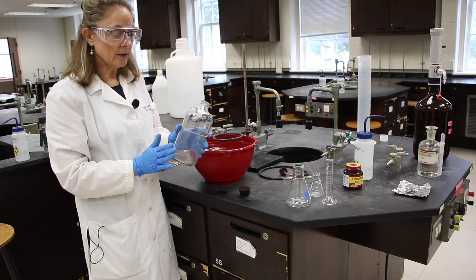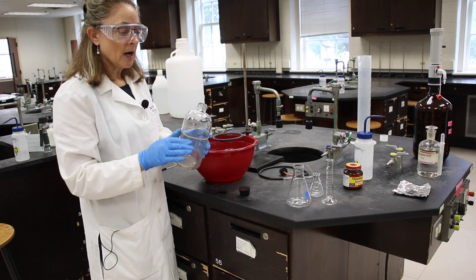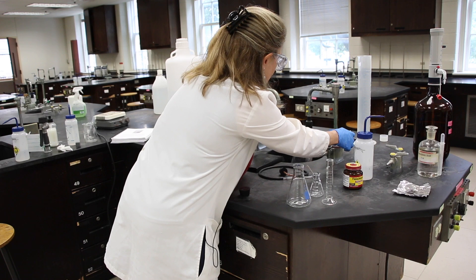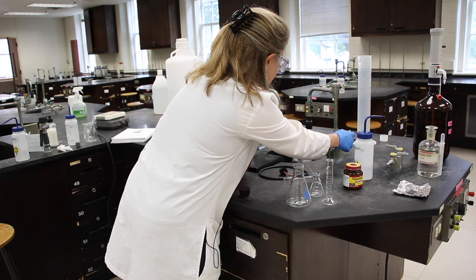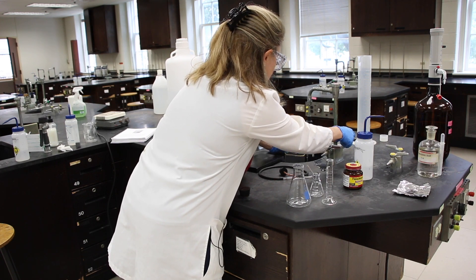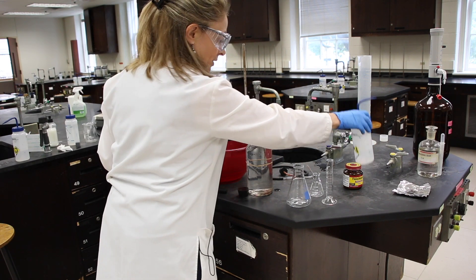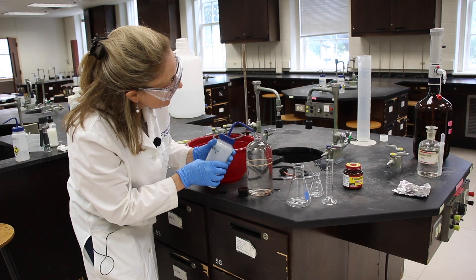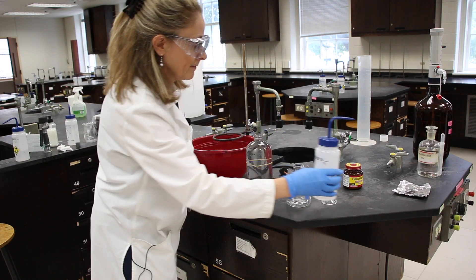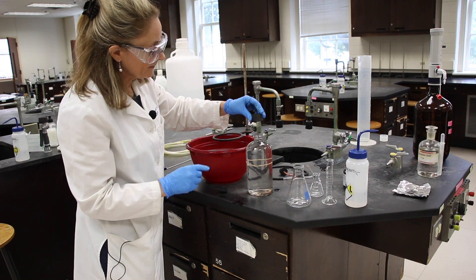Next, we're going to fill this bottle of water almost all the way to the top, and then we're going to make a dome of water with the DI water bottle. When we displace the water, this is how we're going to measure the gas that is evolved. We're going to put a dome of water on the top, and then take the fat end of a rubber stopper and put it over.